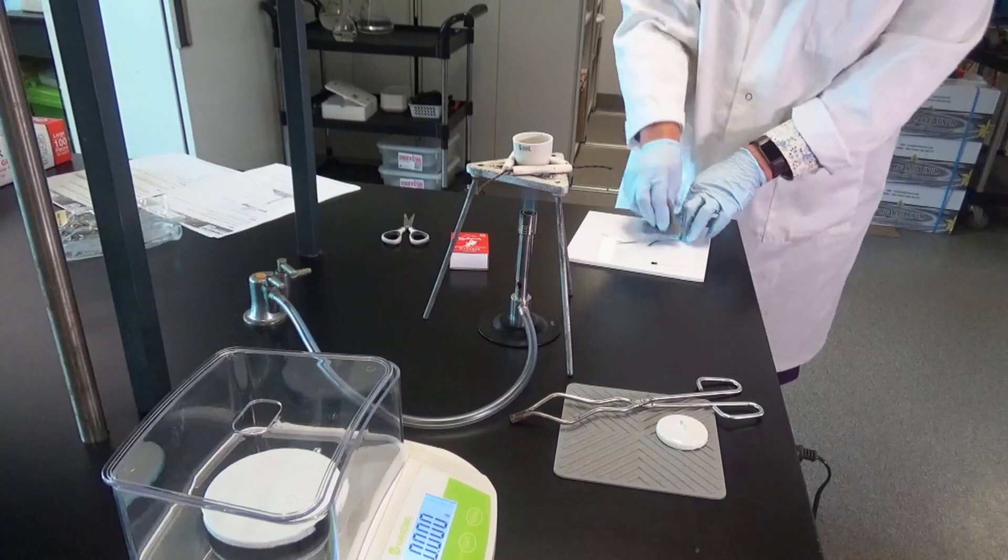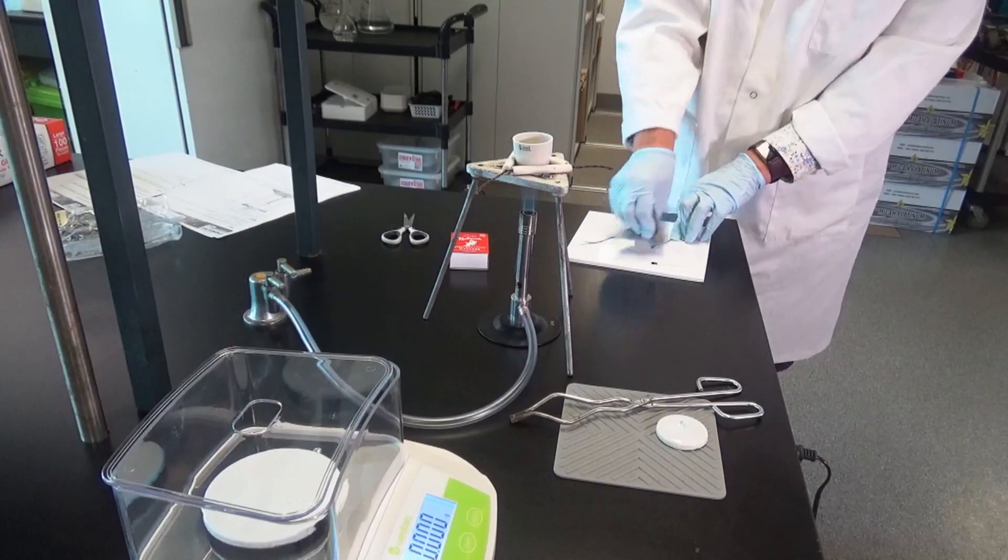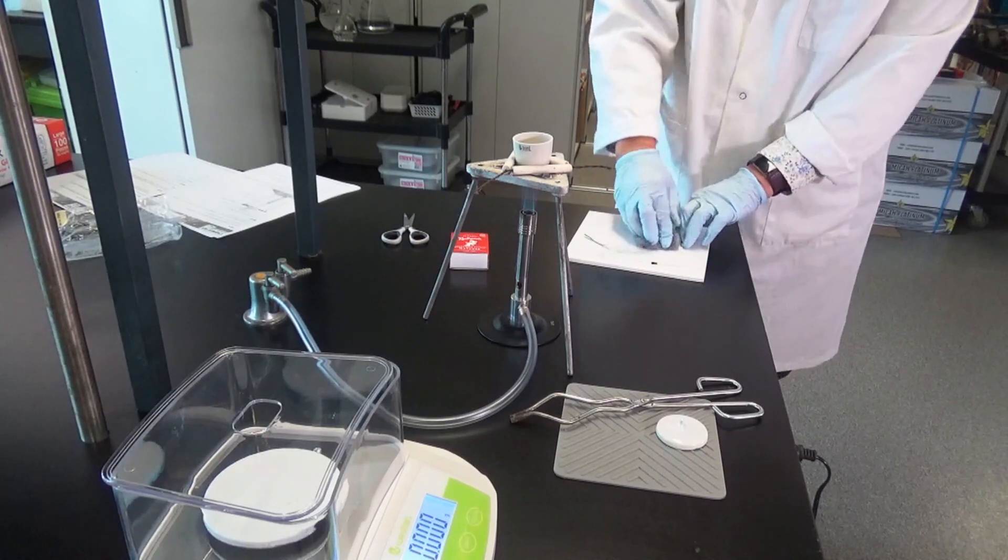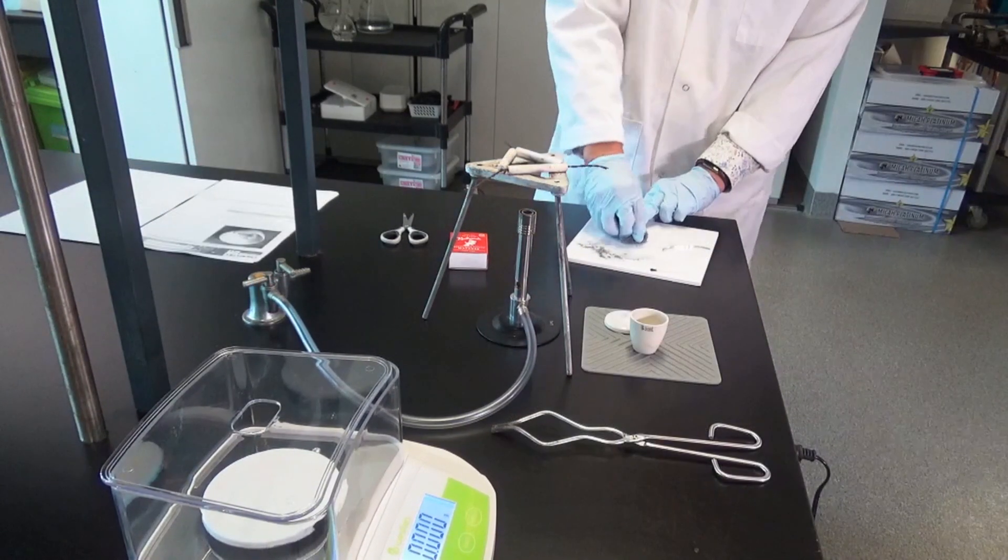That's what I'm currently doing. We're also heating up the crucible so that any water that's absorbed in the porcelain has not been included in any of the measurements that we take.